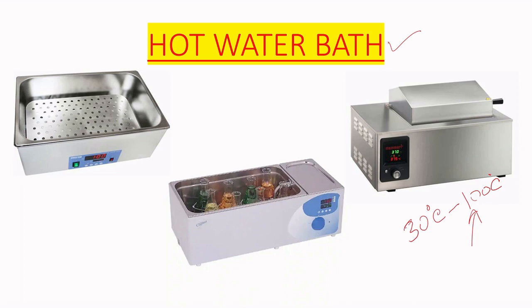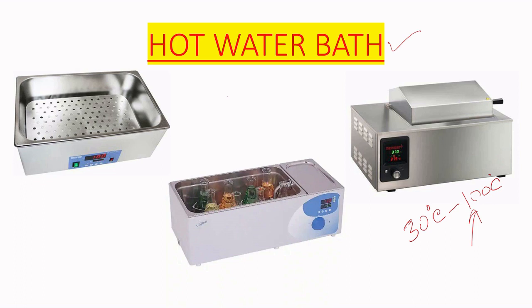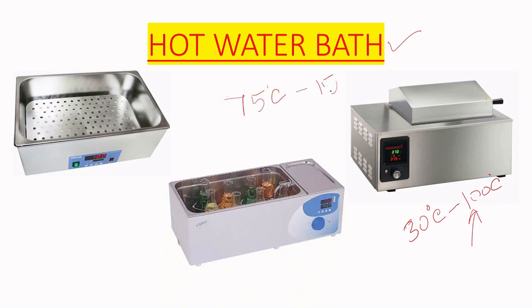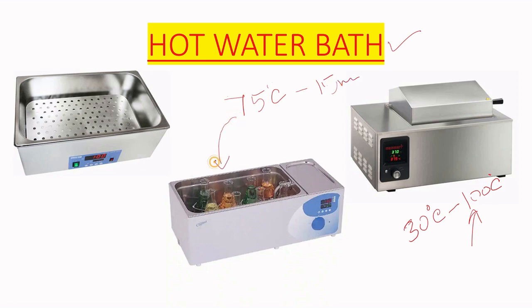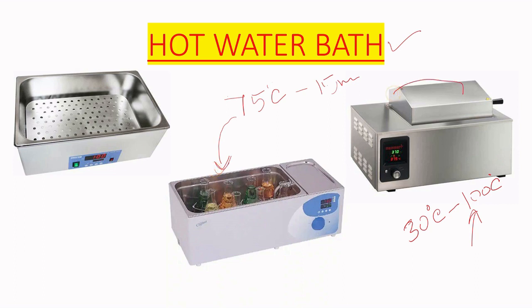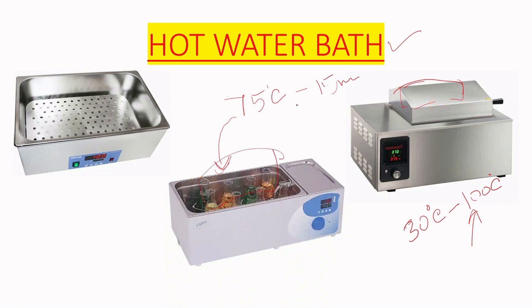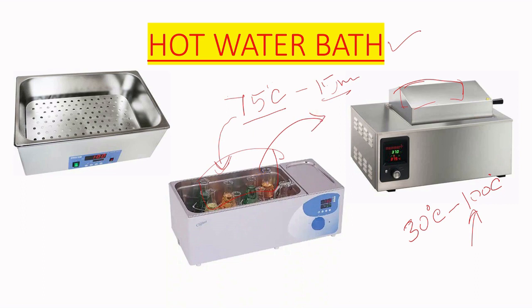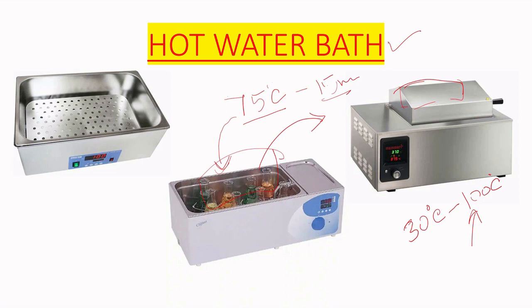Suppose we have a solution or agar media that needs to be kept at 75 degrees Celsius for 15 minutes. We add our conical flask or media into the water bath, close the compartment with the lid, and maintain it at 75 degrees Celsius for 15 minutes before using it for the next step.